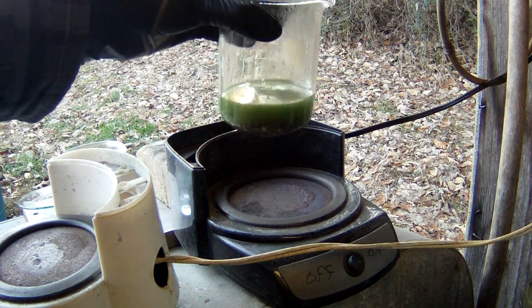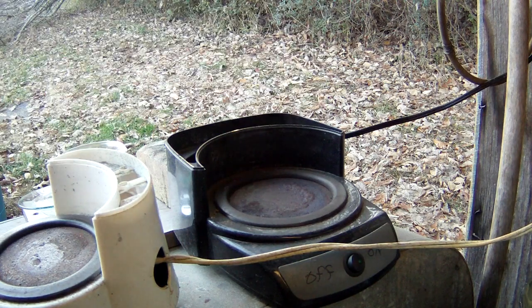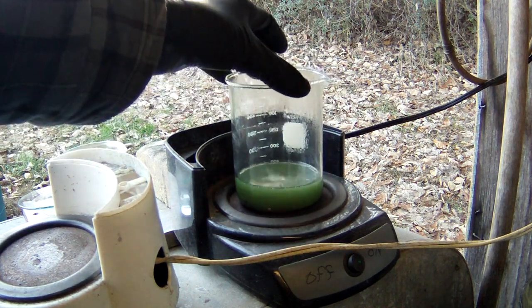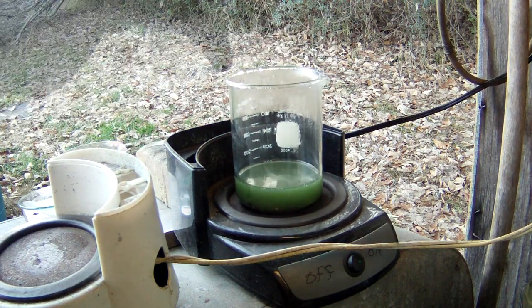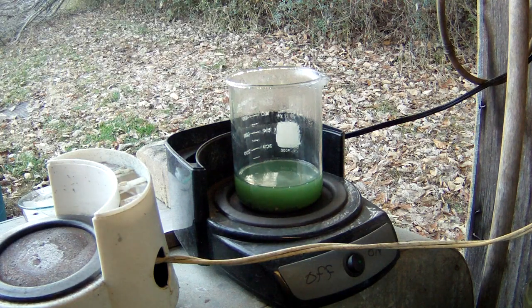I don't know if you can see that in there, but you see we still have quite a lot of metal in there, so I'm kind of guesstimating that some of these are just heavy tungsten plate. We are also ending up with a little powder similar to the powder from Dr. Z, so that must be a common thing with these type of contacts. But like I said, we still are having a reaction, so I am going to let it go. I'm going to add a touch more nitric acid, not too much. If it doesn't perk up, then we know that we got quite a bit of tungsten in there.